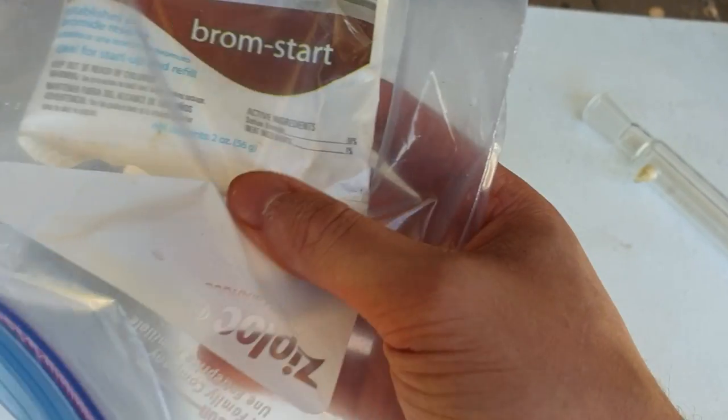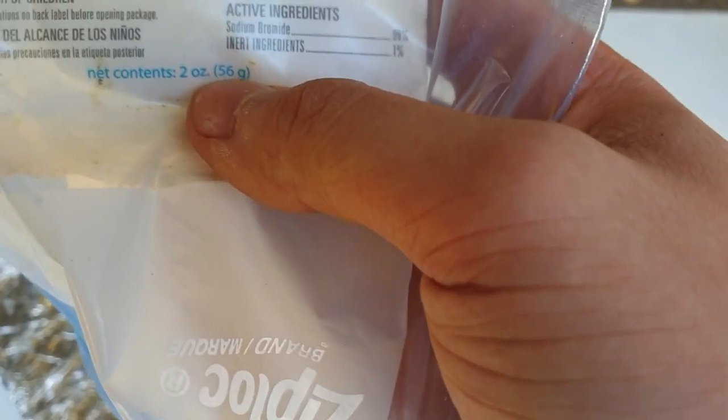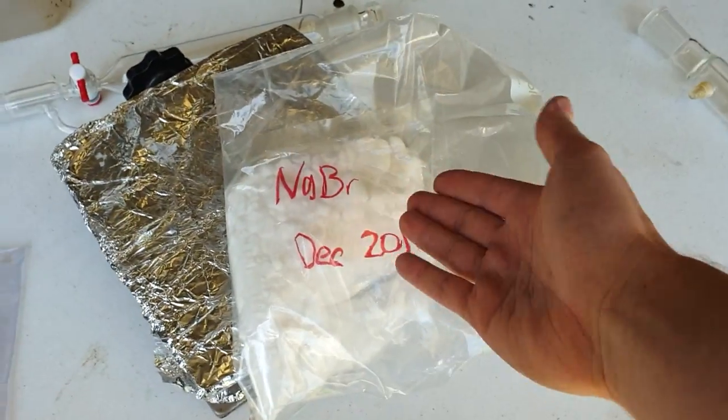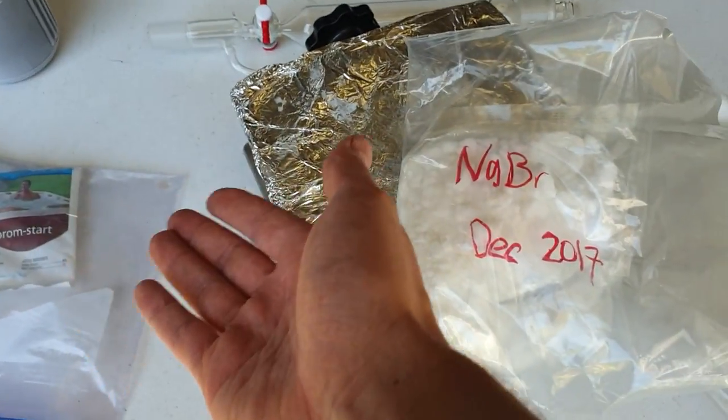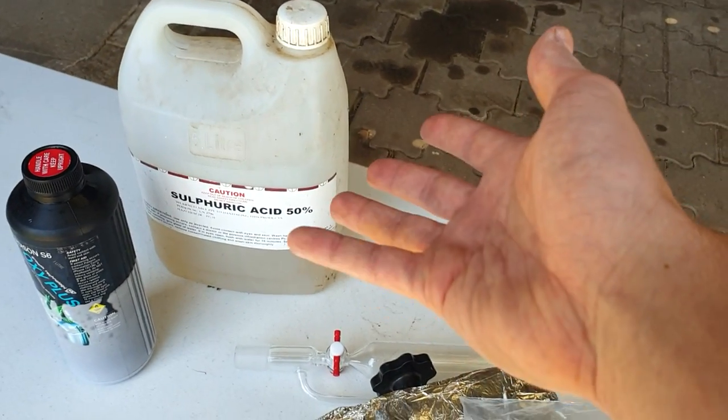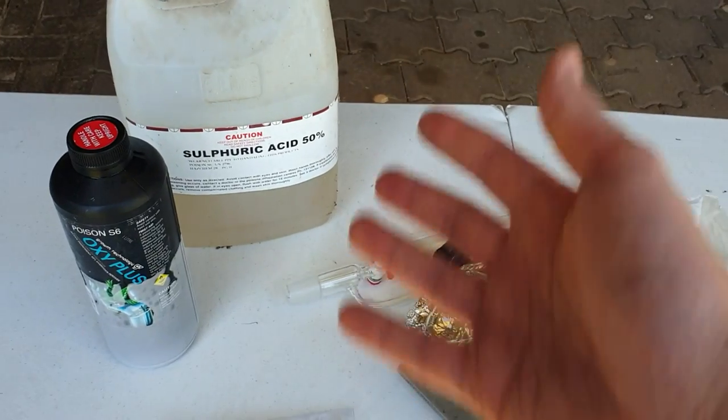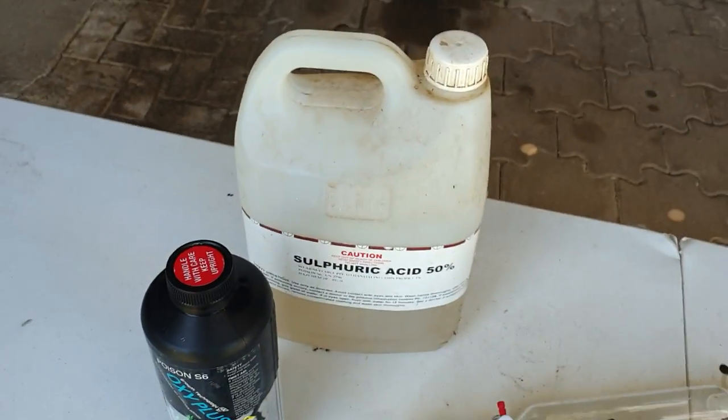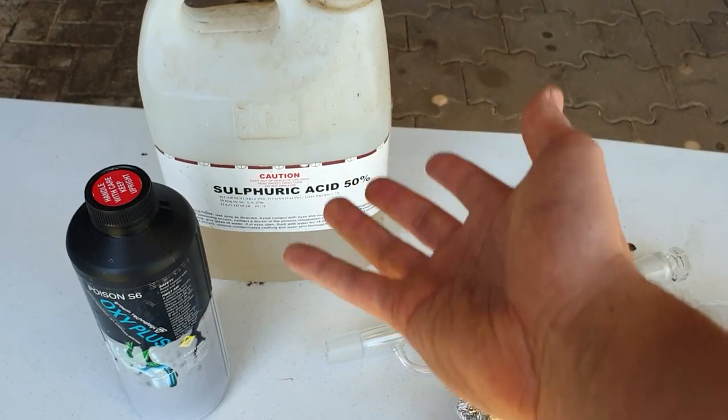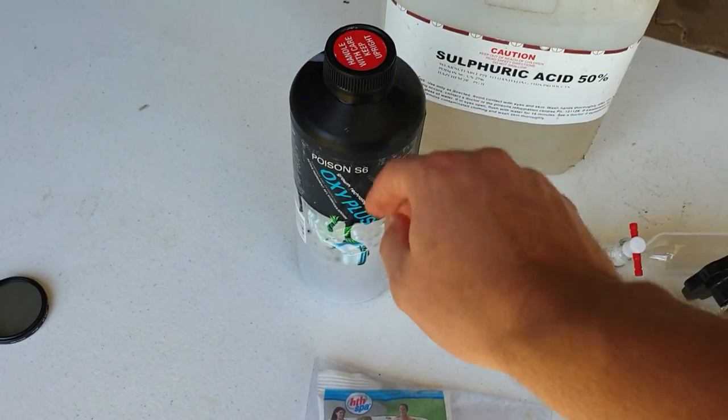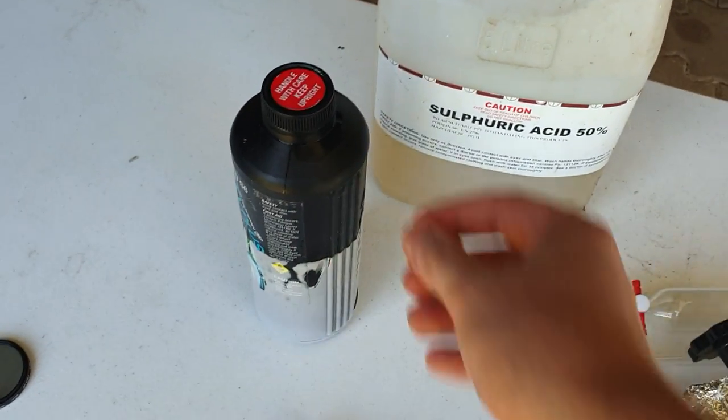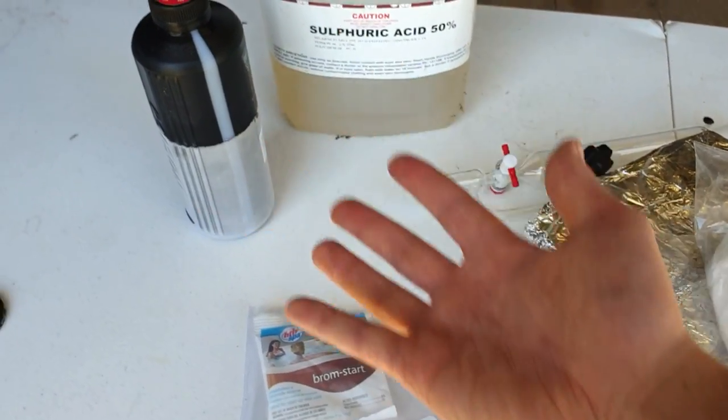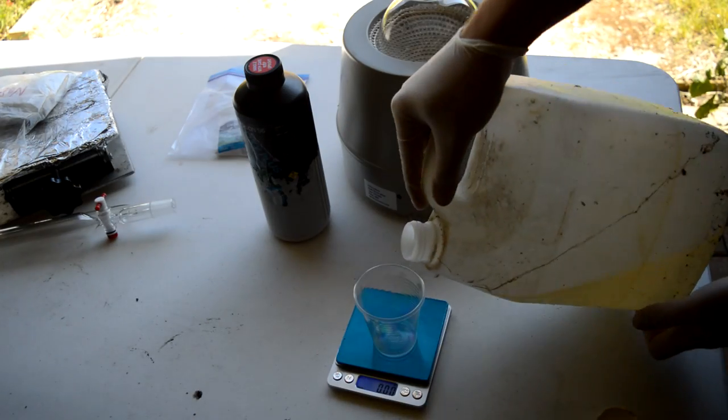There's only about 56 grams of this. We need more bromine than that, so we're going to use some of this and all of this, a considerable amount. We can pretend that I got all the sodium bromide from a hardware store. Also we're going to be using my 50% sulfuric acid because it's just such a waste to take concentrated acid and dilute it down when I have like two liters of 50% acid that I acquired from a cleaning store or something. I'm also using my peroxide, which I did get over the counter many years ago. It's been in the freezer since. It needs to be used up—it's quite old and I have no idea what the concentration is. Source of bromine, acid, oxidizer, so we'll just get this all set up.